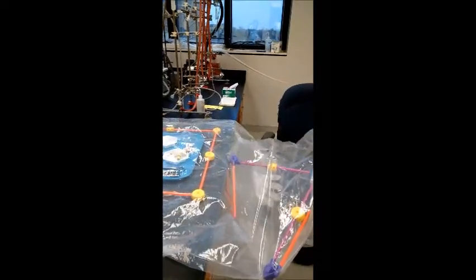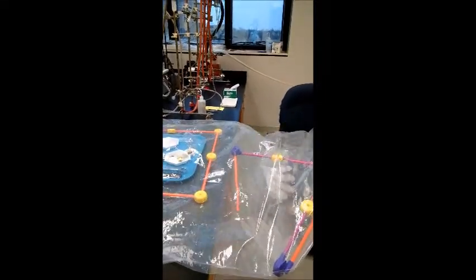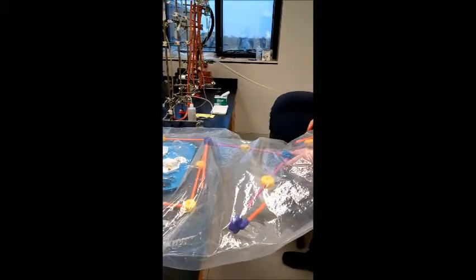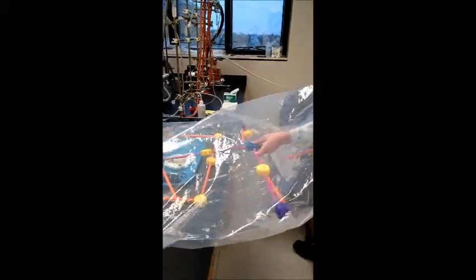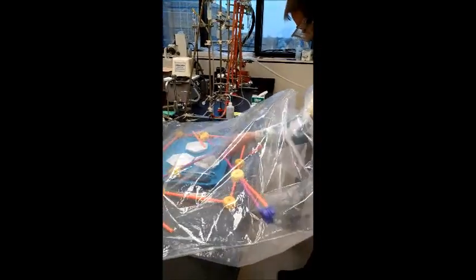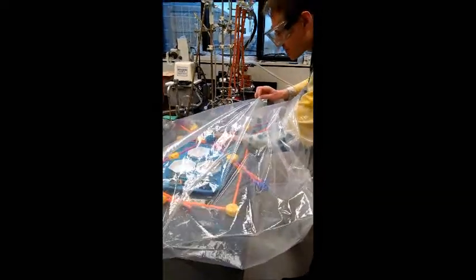You can see we designed a frame. One of your classmates designed a frame here that we will use once we're done purging the glove bag. We'll build it up and make like a tent support.